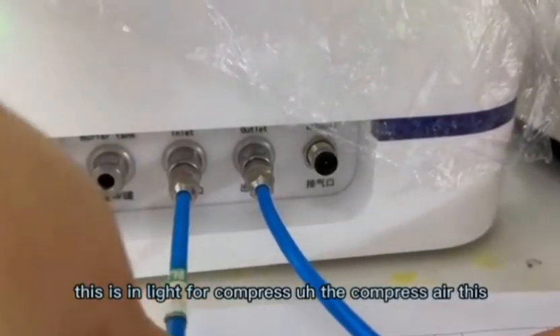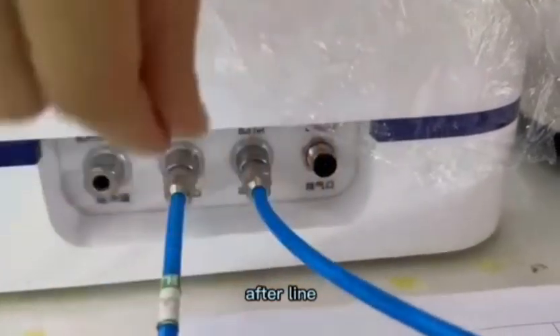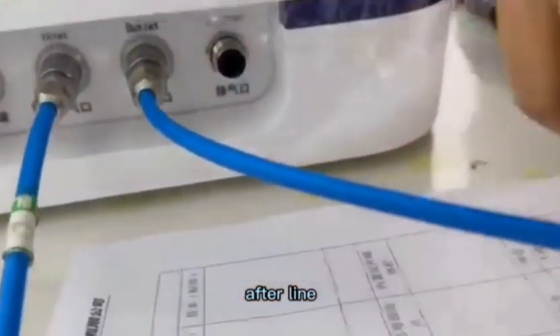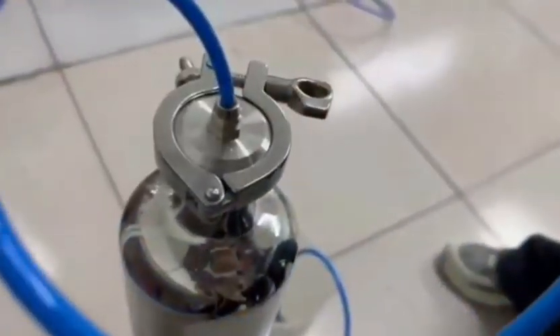This is the inline compressed air. After that is the line for the filter housing, where we connect the filter housing.